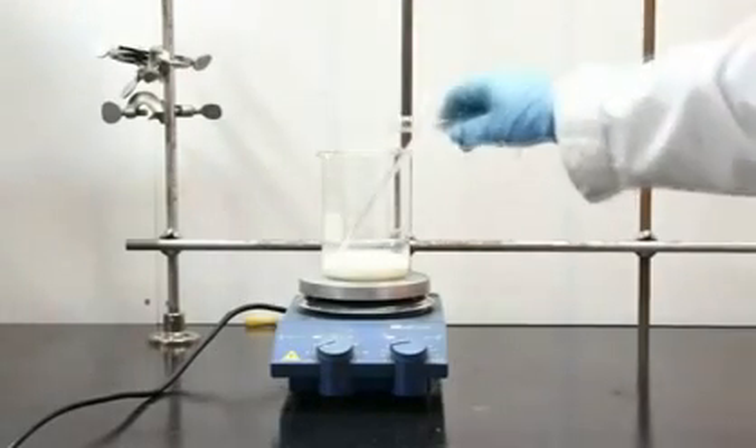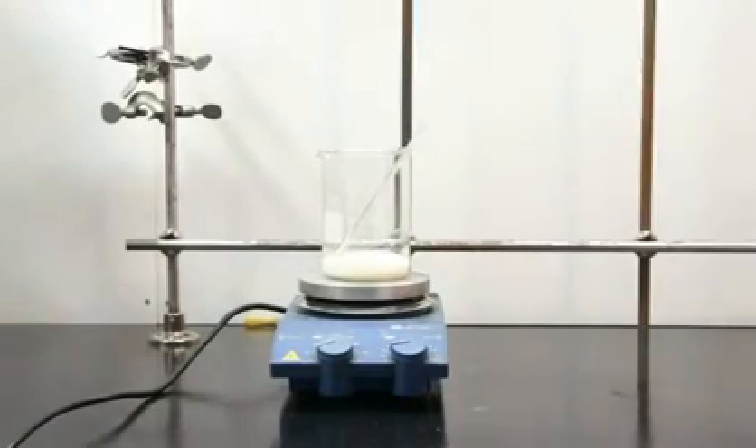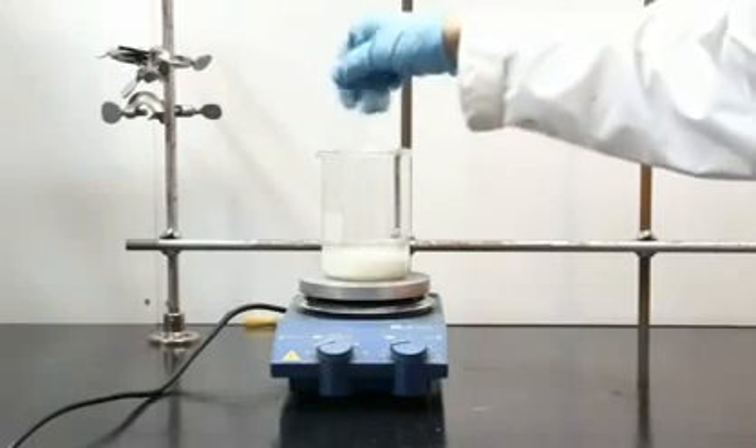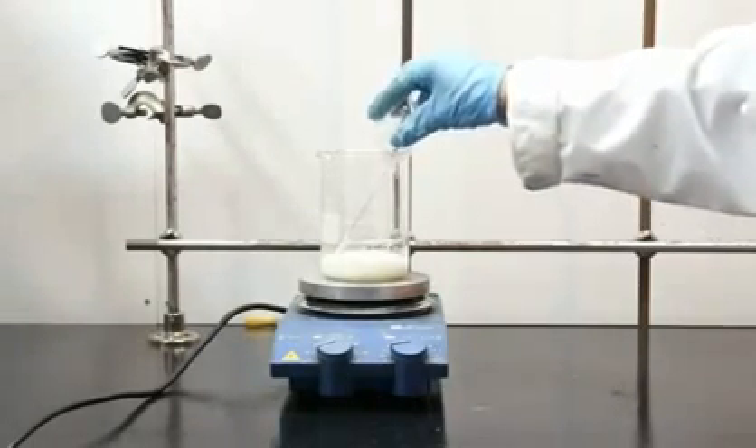Charge in your glycerin — it's pretty thick so make sure it all gets in there — and mix thoroughly. Then finally you can add in your vinegar, and again, mix it all up.